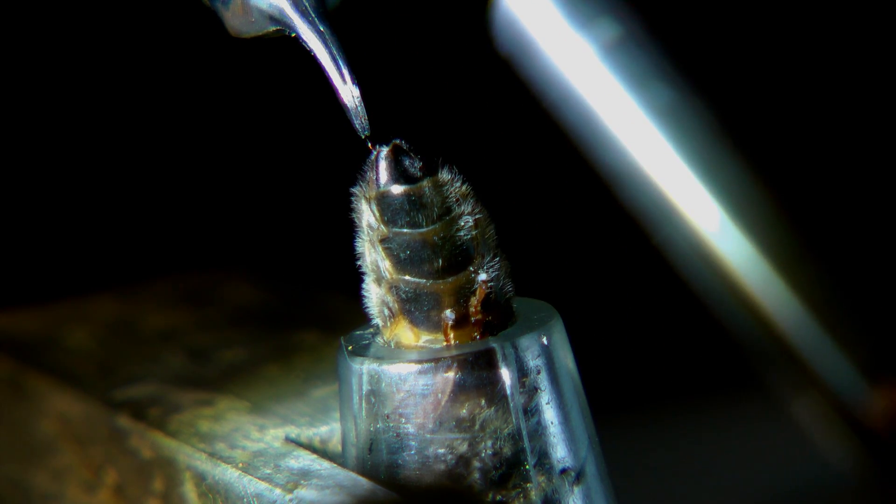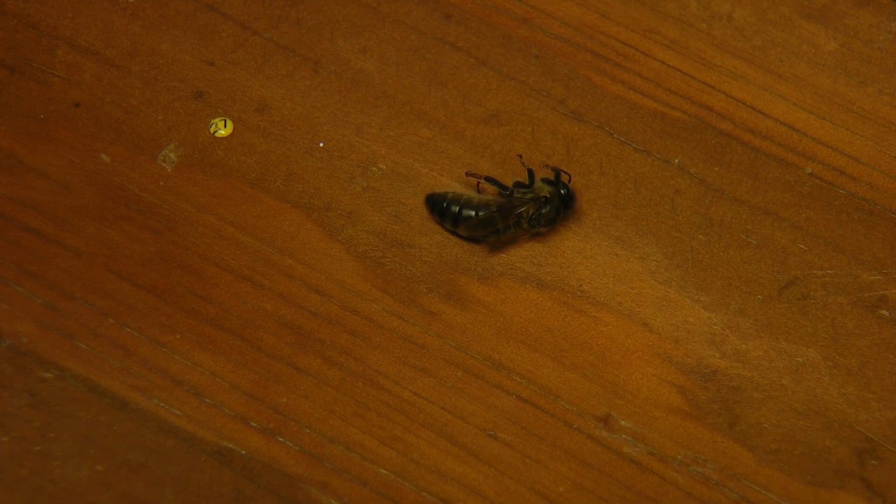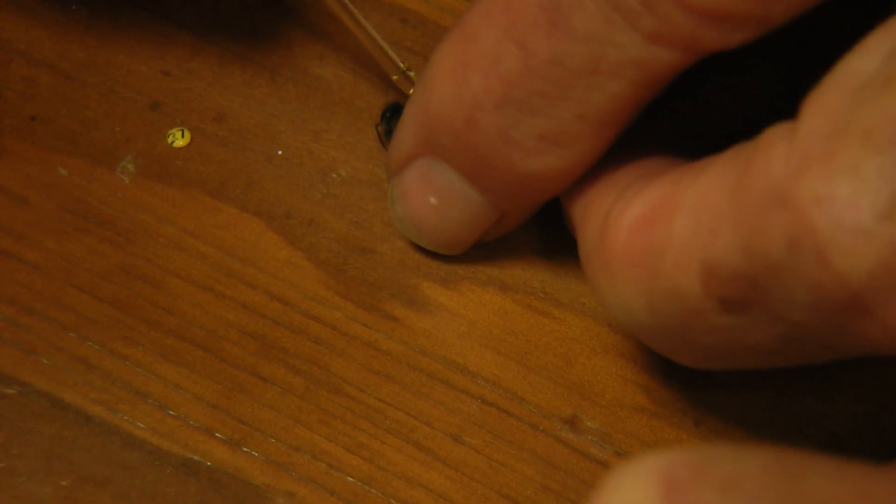There, it's done. Bill removes the now fully unconscious bee.